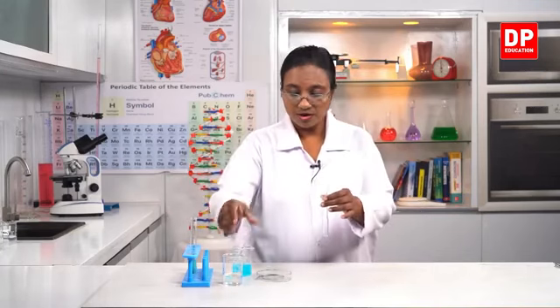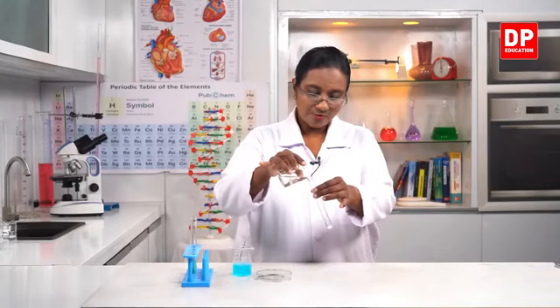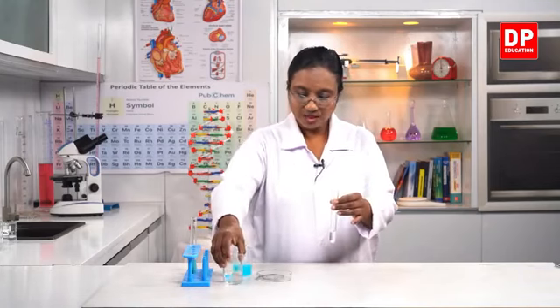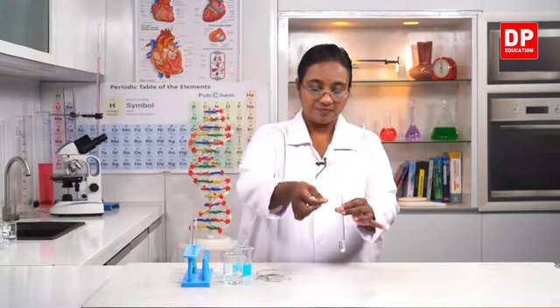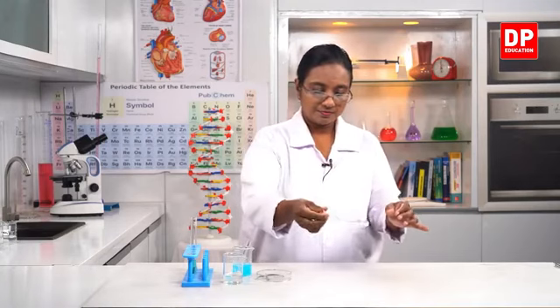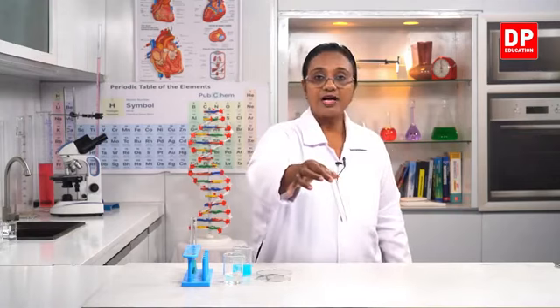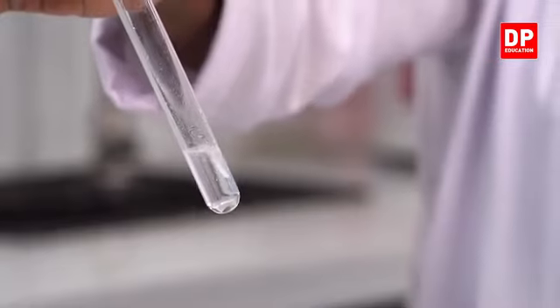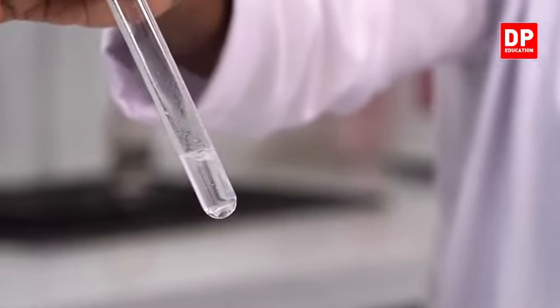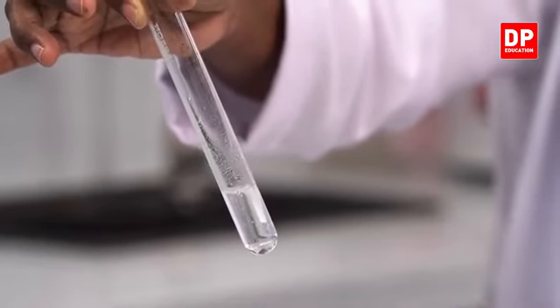Here I'll take a small amount of hydrochloric acid solution into this test tube, HCl solution, and into that also I will put a piece of clean magnesium strip. So when I do that, here again you can see the reaction. This is the evolving of hydrogen gas. You can see the liberation of a gas there. Can you all see it clearly? You can see the reaction between magnesium and HCl, and you can see the liberation of a gas.